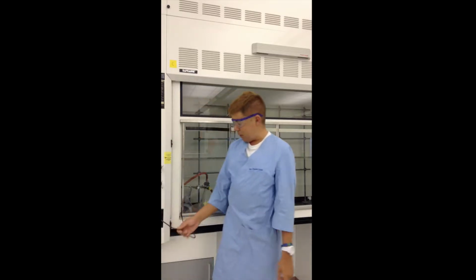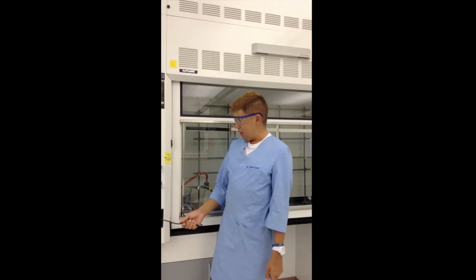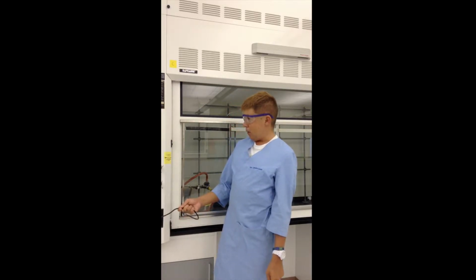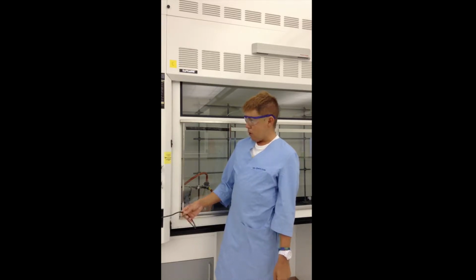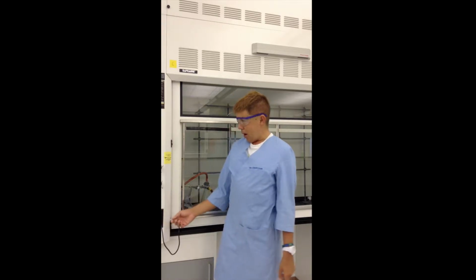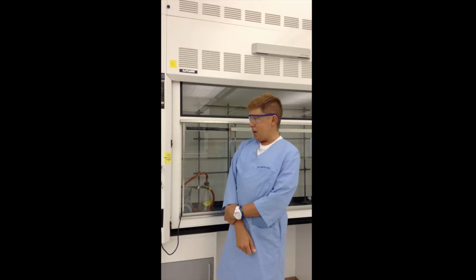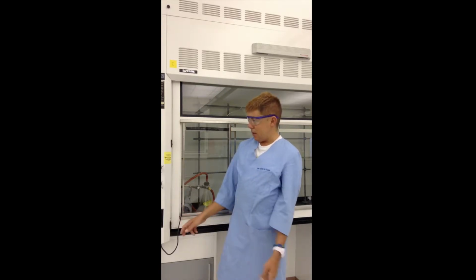You see here there's an electrical plug going into the wall wire. Electricity you have in the house, in your building, is basically the flowing of electrons or charged particles. That's how you get electricity in the wall. And I want to demonstrate today that ordinary ions are actually conductive and carry a charge just like electricity in the wall.